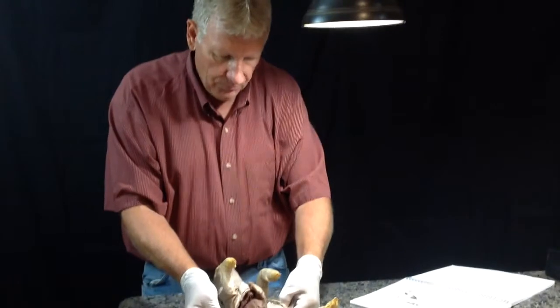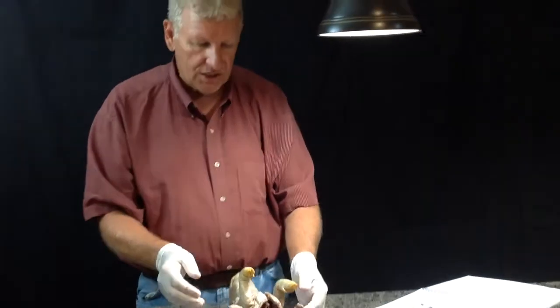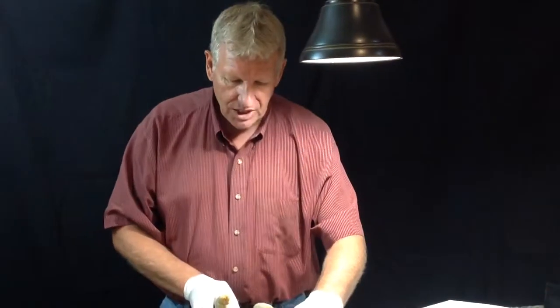As soon as the body dies, the oxygen, which is in the hemoglobin in the blood, begins to separate. So now what we get is a watery mix, and the blood is no longer blood.